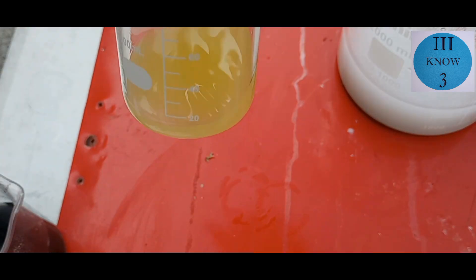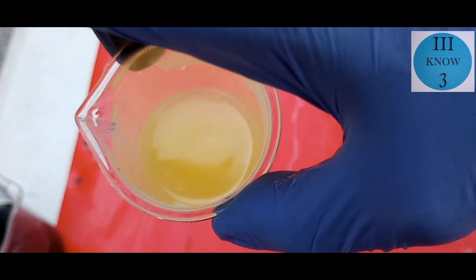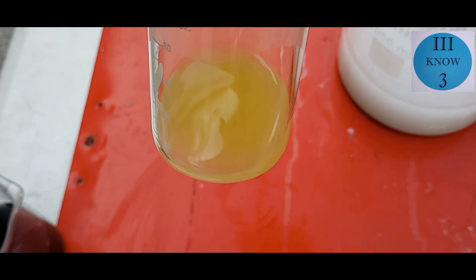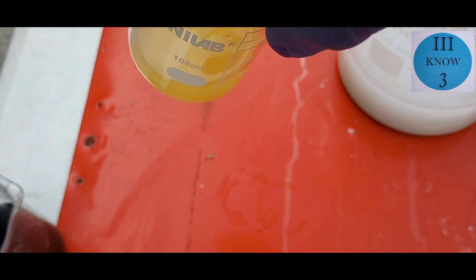So I think this yellow color confirms that there's a presence of a lead salt. It could be lead chloride, it could be lead sulfate, but it's definitely lead. I really hope you guys enjoyed this. Thank you so much.